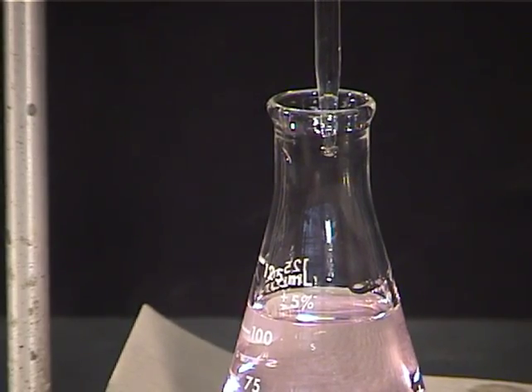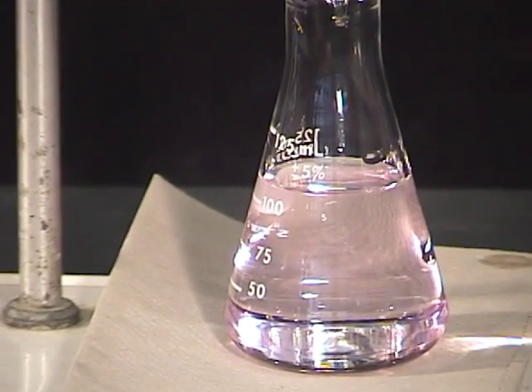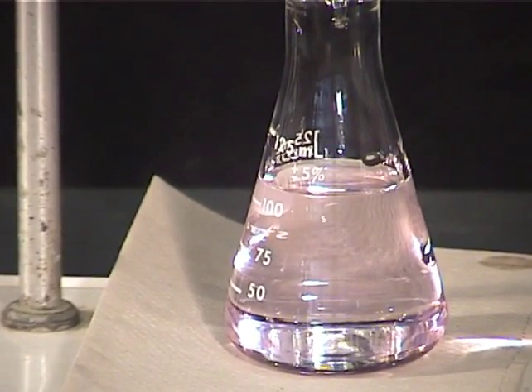You are looking for the one drop or split drop that causes the color to change for at least 10 to 15 seconds.